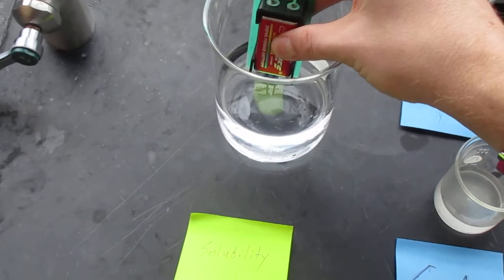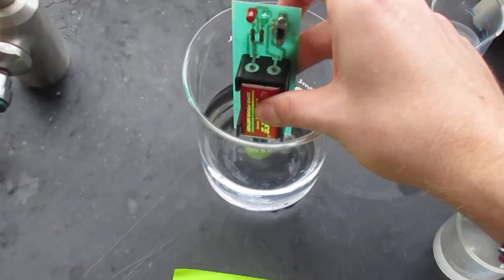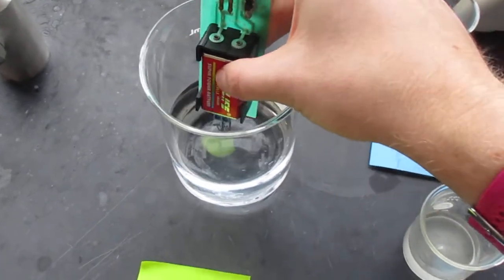You might be surprised to see that neither of those lights is turning on.